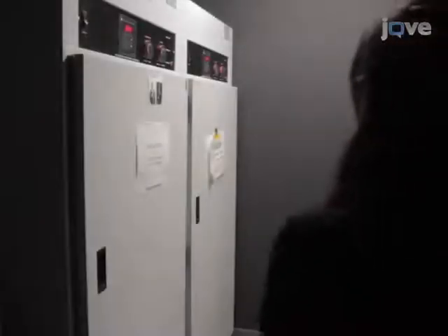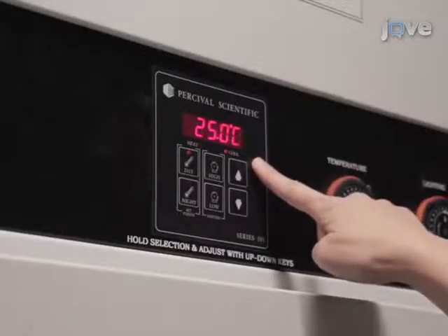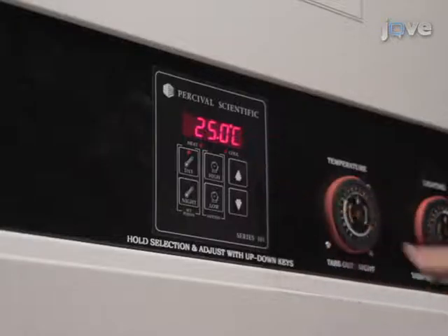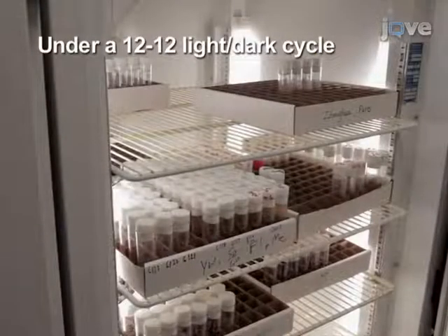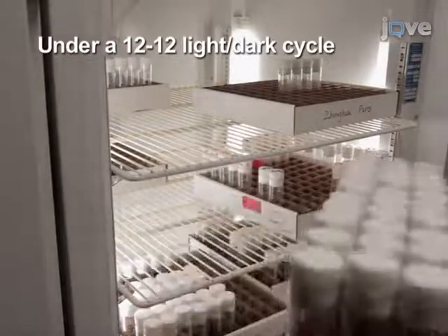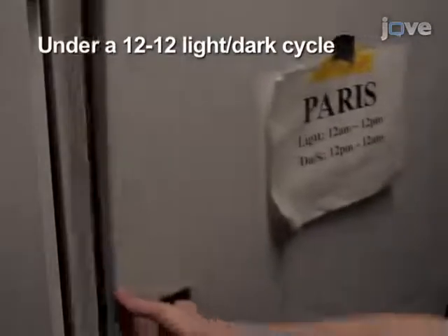To facilitate reproducible staging of the developmental phases, keep Drosophila at a constant temperature of 25 degrees Celsius and under a 12-12 light-dark cycle. Under these conditions, third instar larvae will be available at about 96 hours after egg-laying.